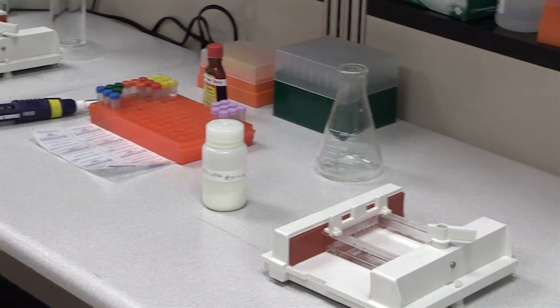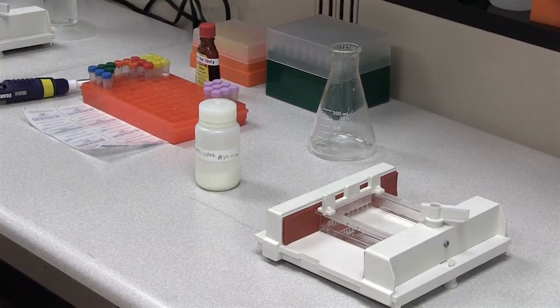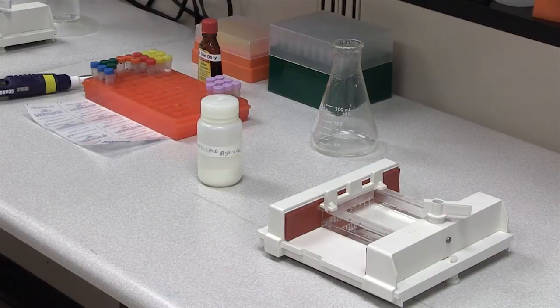And now what we are going to have to do is not disturb the tray. The agarose has to sit and it has to firm up before we can load it. So we are going to have to let that sit for about 20 minutes.